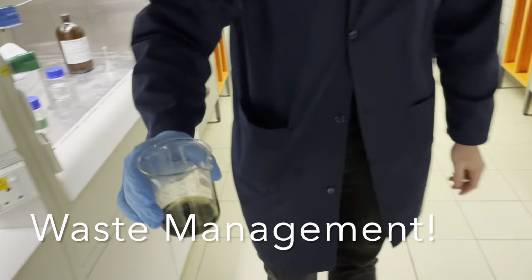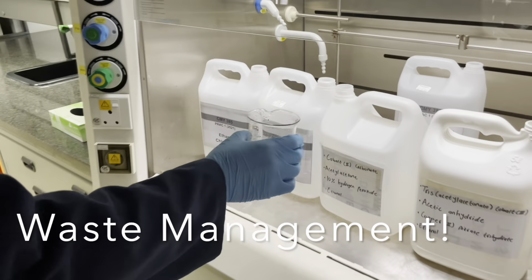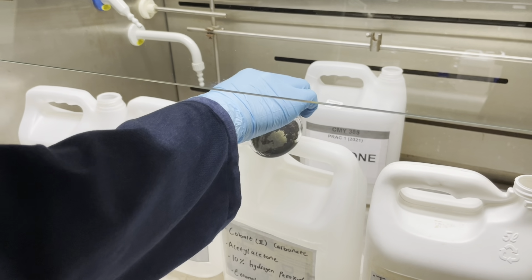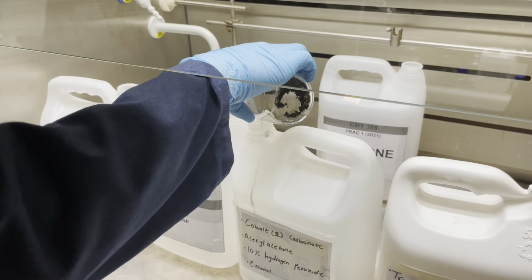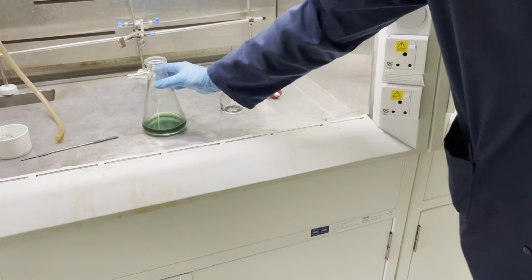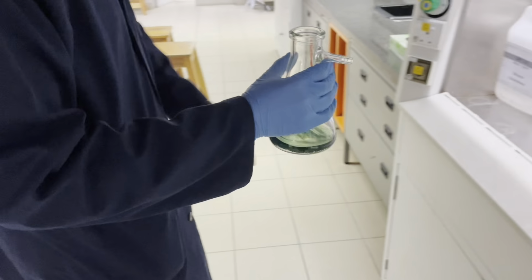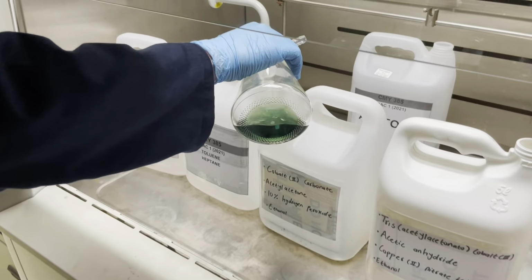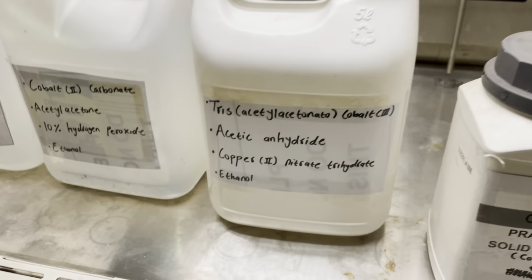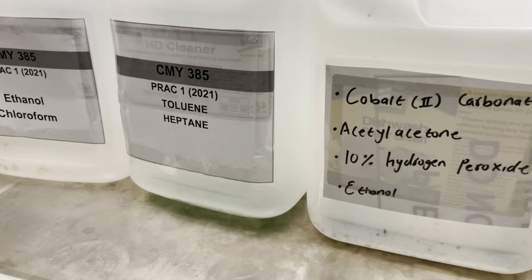A final note is on waste management. Always ensure that you place your waste in the correct waste container. So whether it was your heptane waste, your filtrate waste, or your washing waste, for each step of your experiment, there will be a waste container labeled appropriately, and you just need to follow the correct labels as illustrated here in the video.